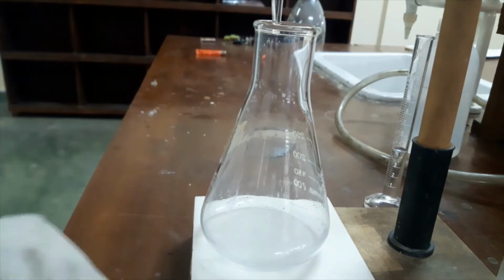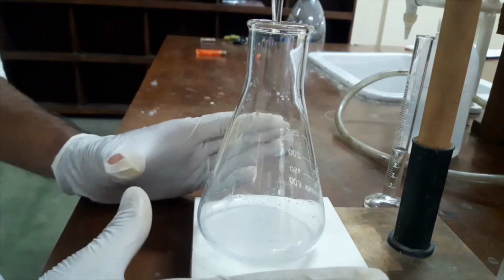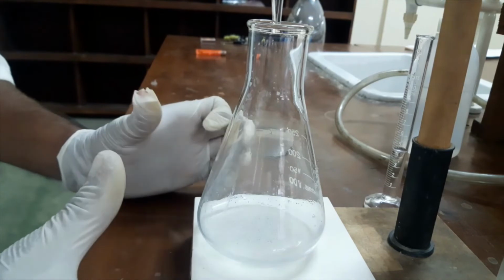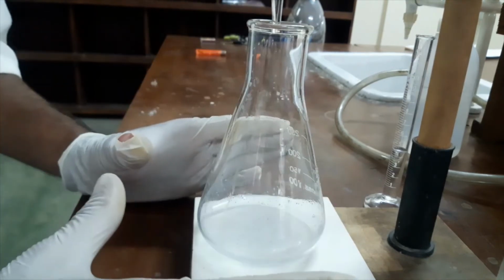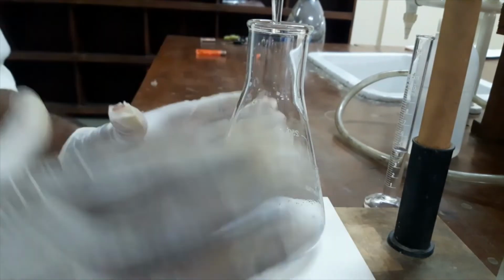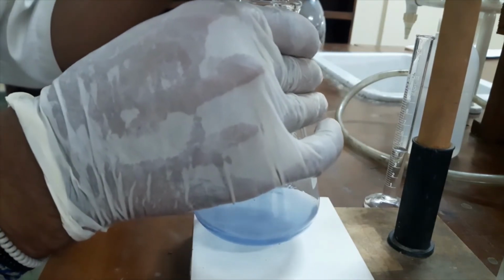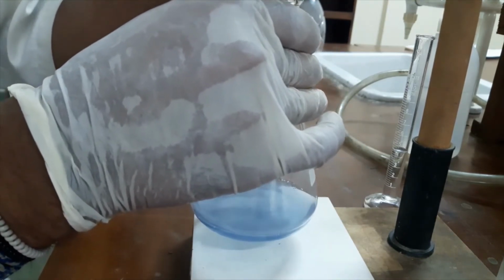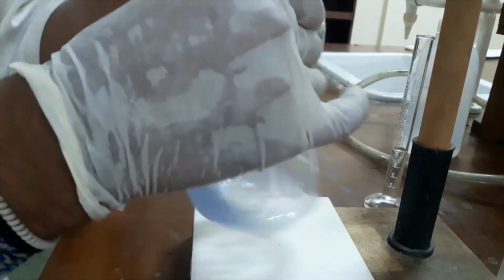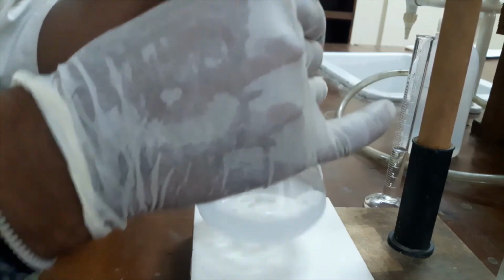But the important thing is, in starch structure there are amylose and amylopectin structures. Some iodine molecules may be trapped inside those amylopectin structures. So we have to release those trapped iodine. Okay, if we wait some time, the blue color will reappear. That means iodine is being released from the starch-iodine complex. Now it's again colorless, but I am not sure.